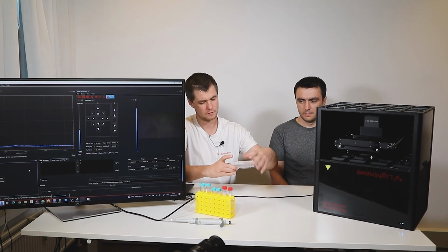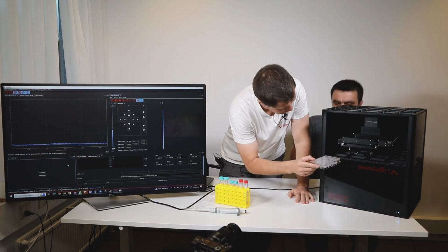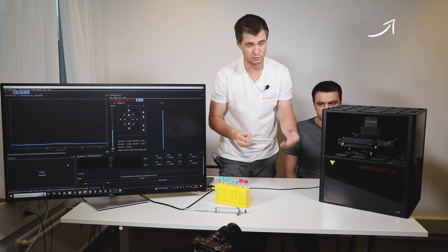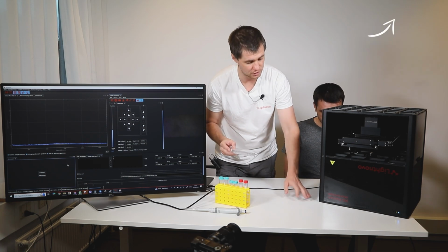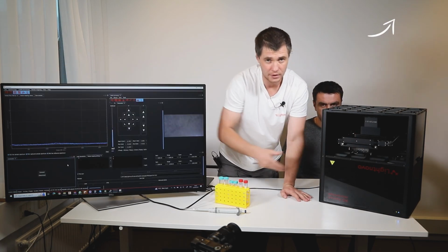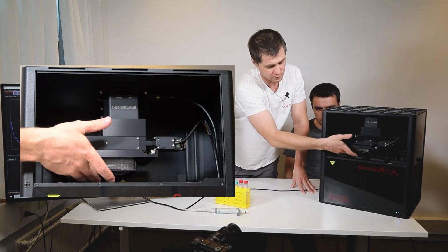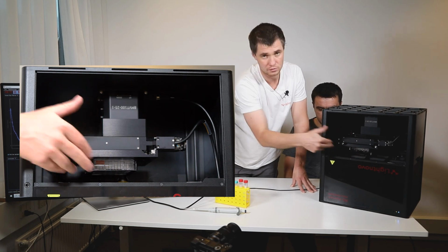When we would like to routinely measure a lot of liquid samples, here we already attached the adapter for the multi-well plate. If you want to know more about how to change the adapter from normal sample measurements in Raman microscopy to the multi-well plate, you can find our previous videos focused on that topic. You just insert it inside, and you have a special screw here to lock the multi-well so it's not moving.